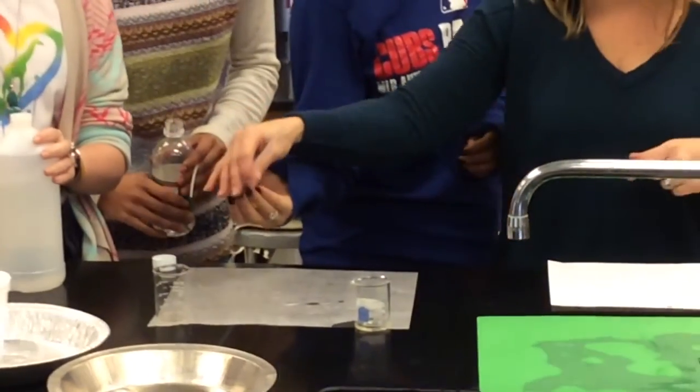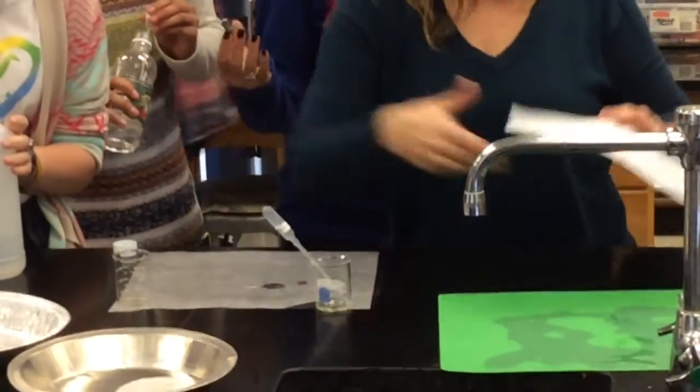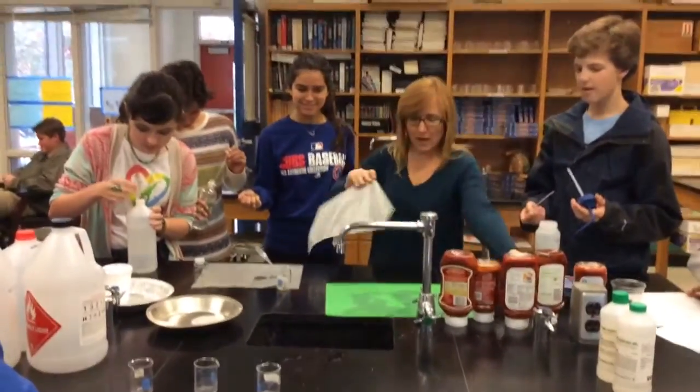Oh, okay. What did I do? You squirted all over the place, is what you did. Touch it. All right, so let's get another. I'm sorry. It's okay. It's all right. So here we go.